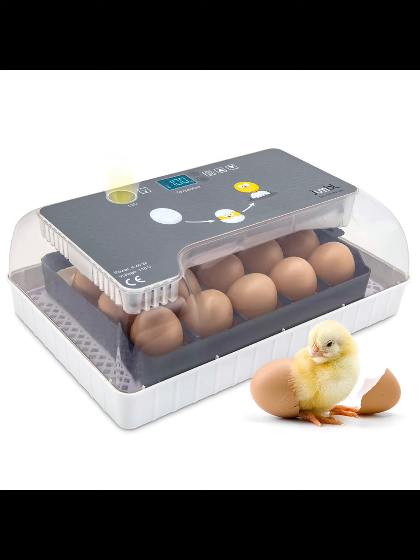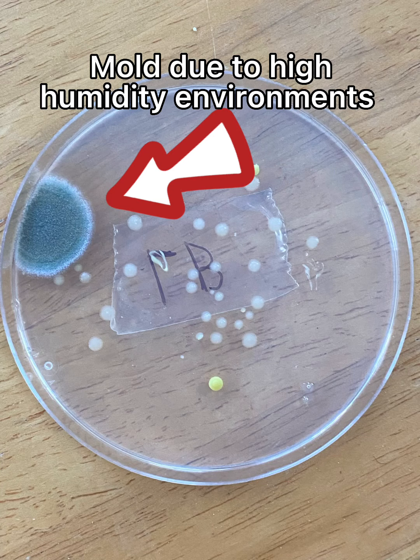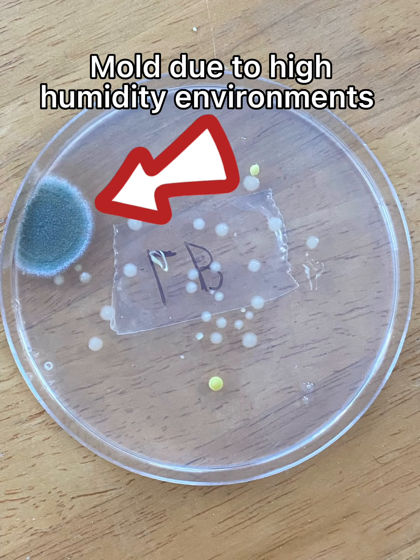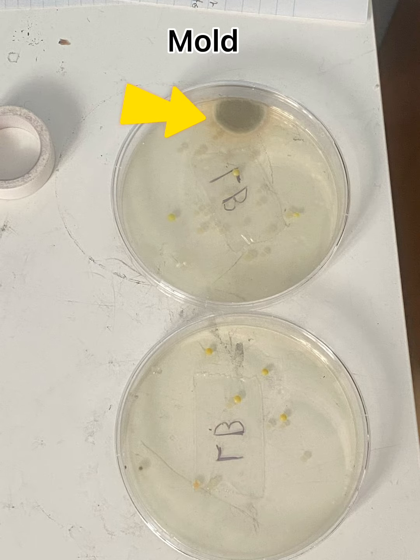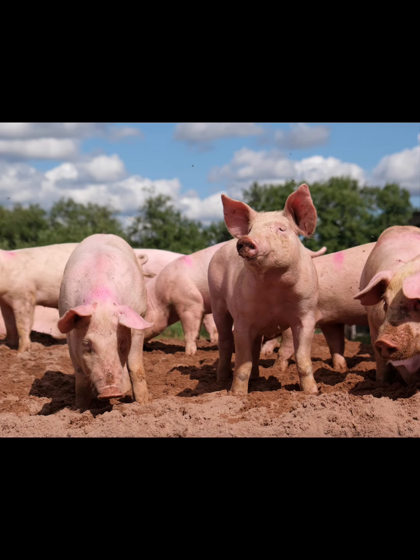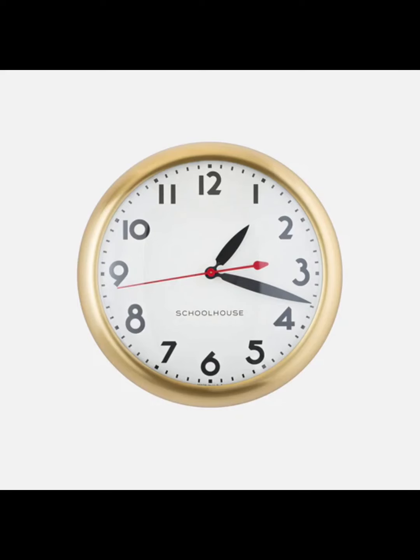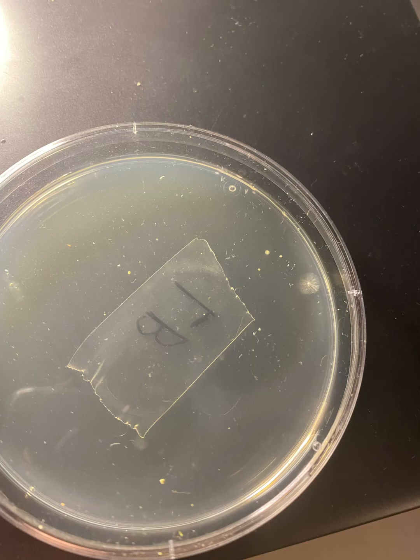Growing your E. coli at temperatures around 36 to 37 degrees Celsius will allow them to grow faster and reduce the chance of mold or other contaminants growing alongside with your E. coli. E. coli grow optimally around 37 degrees Celsius, as this is the temperature that they're used to living in the digestive tracts of certain mammals, especially humans. Depending on the moisture levels and temperature that you grow your E. coli at, expect to wait between 2 to 6 days for enough E. coli growth to occur for the next step.